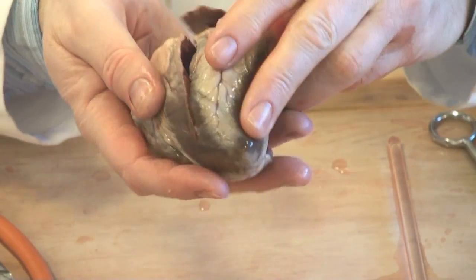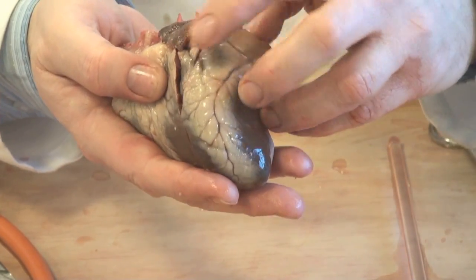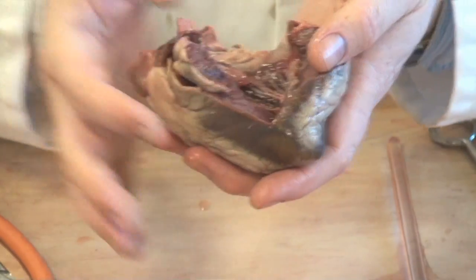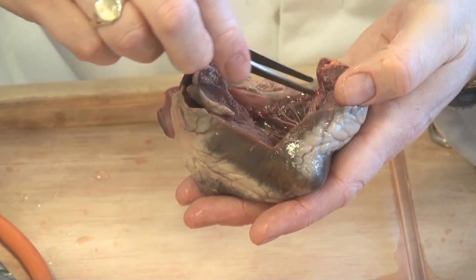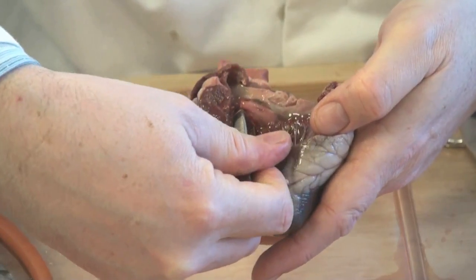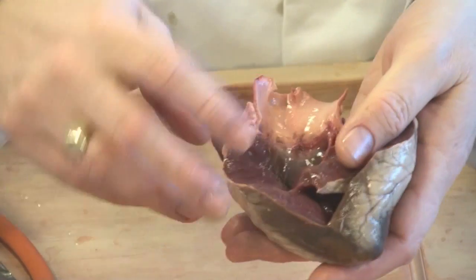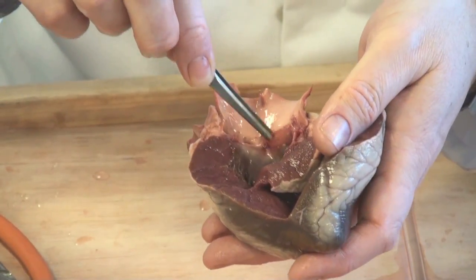I've done exactly the equivalent incisions on the left-hand side. I started in the left atrium, butterflied that open to the left ventricle — a much thicker wall, which you'd be pointing out. The valve flaps are again here, with the strong cords tying them down, and then up here you're going out into the aorta. Blood flows that way, so I've cut the aorta open, and there's our butterflied-open aorta with the equivalent semilunar valves to those in the pulmonary artery.